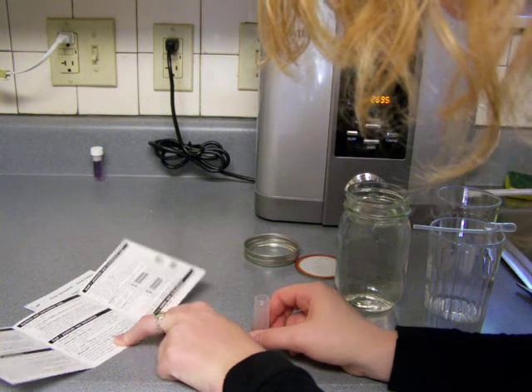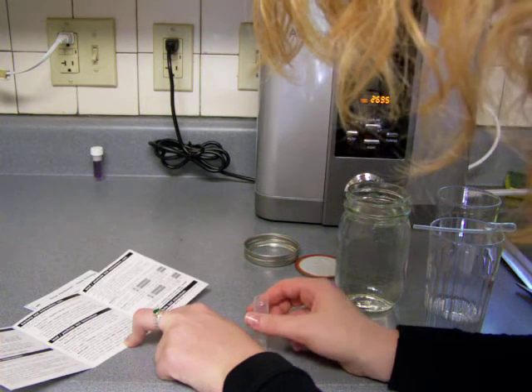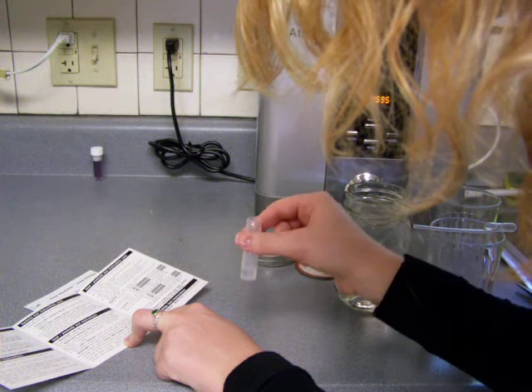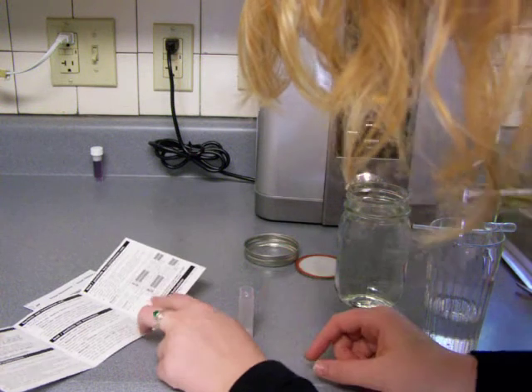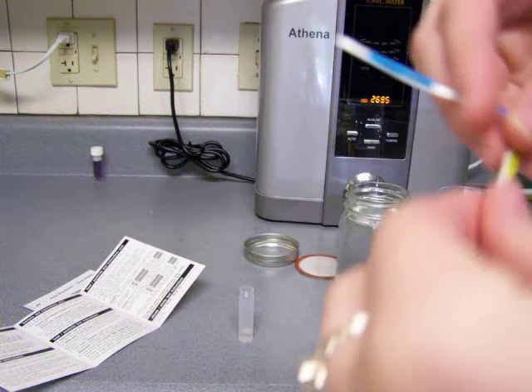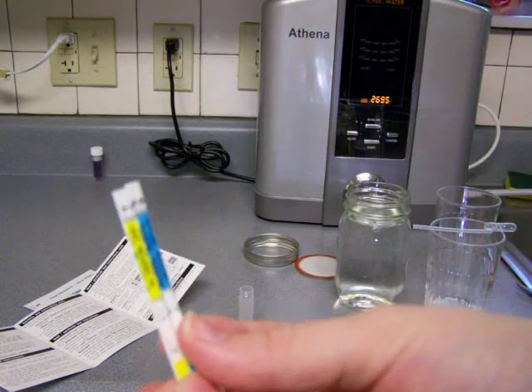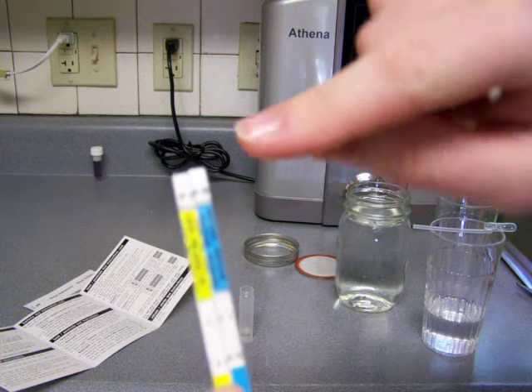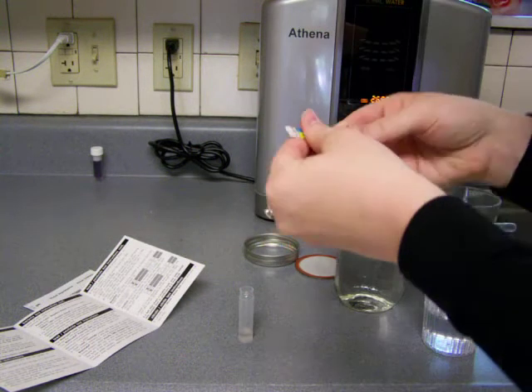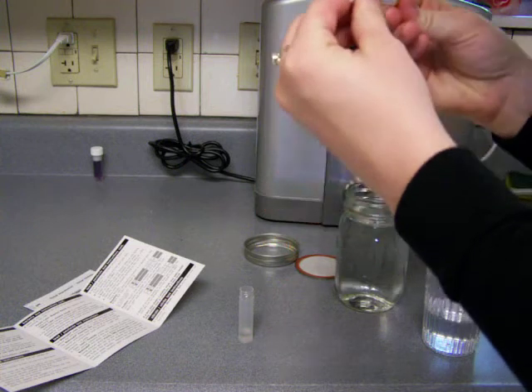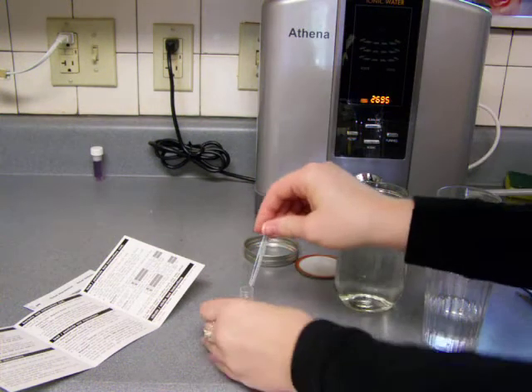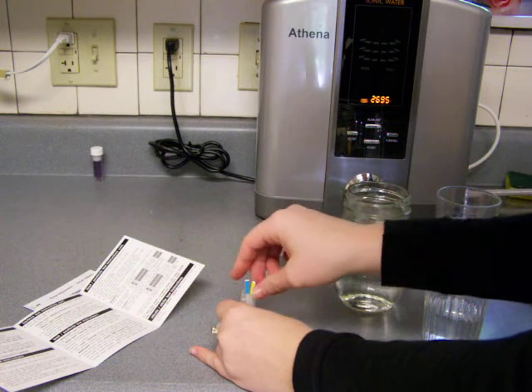Swirl the vial gently for several seconds. Place on a flat surface. Place both test strips into the test vial with arrows pointing down. Okay, so there's arrows here and here on the tops here. I don't know if you can see that, but so I'm going to place these in there.